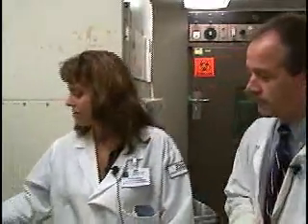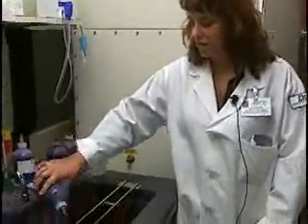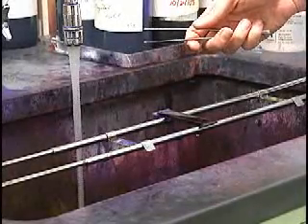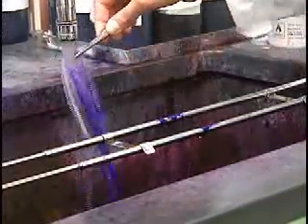The first stain that we put on is called crystal violet — this is the initial stain. This slide is a heat-fixed slide of the organism. We place the crystal violet onto the slide for 10 to 60 seconds. It stains all of the material on the slide: cells, bacteria, and any debris such as protein. After the time is up, we rinse it off with water.